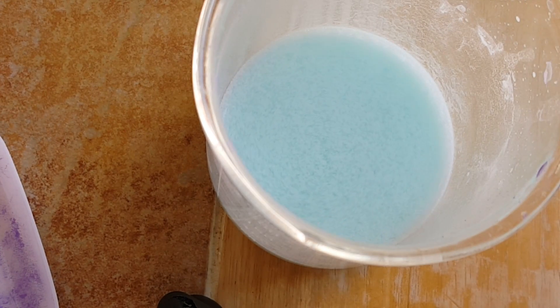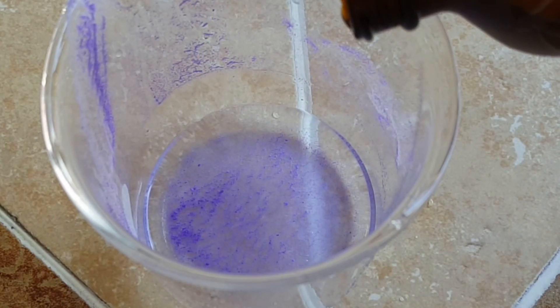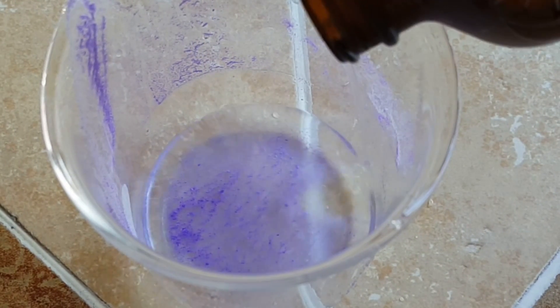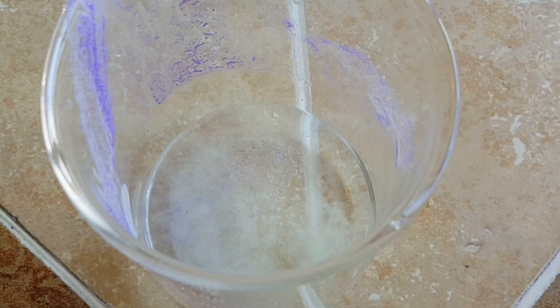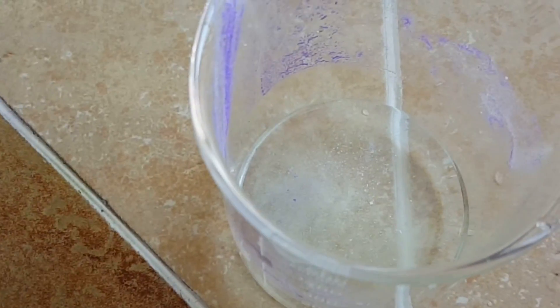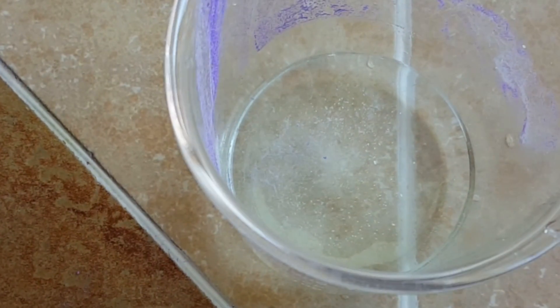What's left in the container, I believe, is copper hydroxide, and this is kind of indicative by the color, simply because I started with copper sulfate. So it would seem to reason that a very basic solution would produce copper hydroxide. This next reaction will prove the valence state of the copper in solution. I added in some hydrochloric acid, and it seems that after this addition, a whole bunch of white insoluble precipitate is formed. You can see that even with swirling, the particulates do not dissolve, which means that this is indeed an insoluble copper complex.